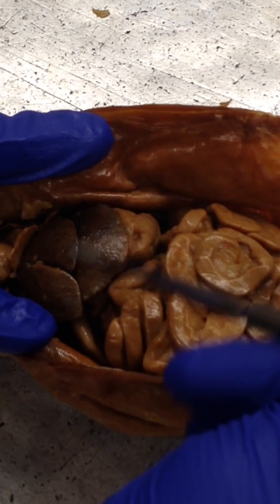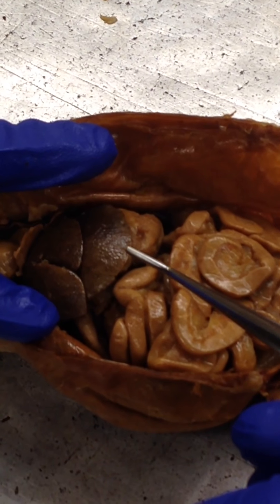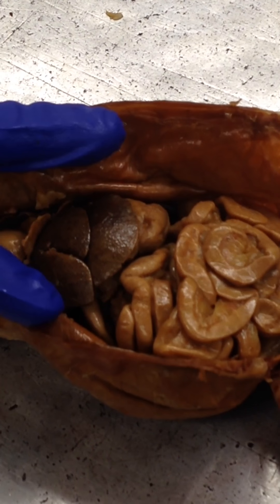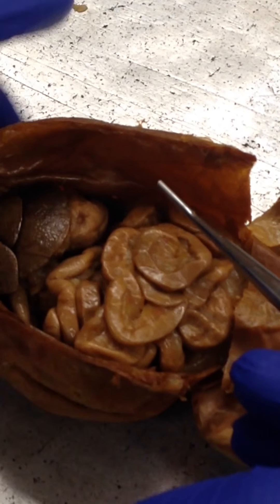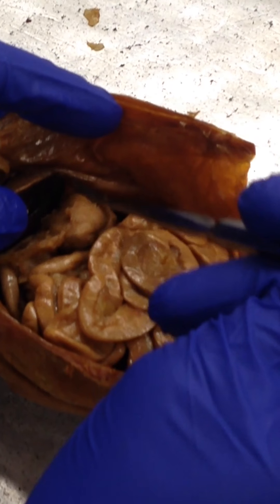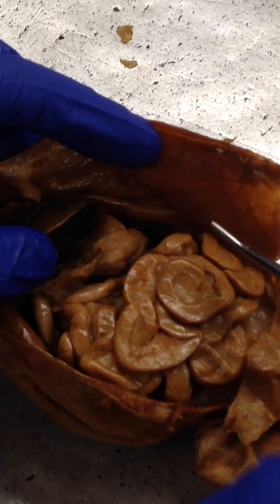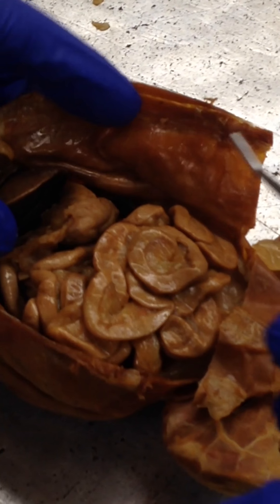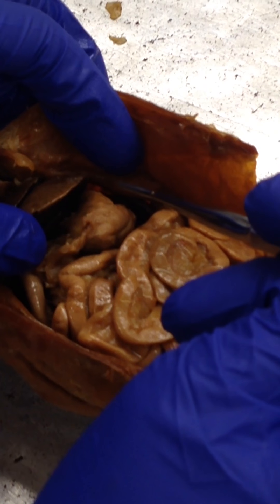The lobes here are the liver. And this is the stomach right under the lobes. Here's the stomach.